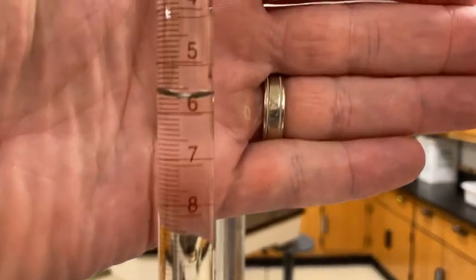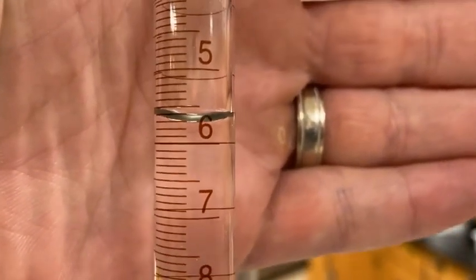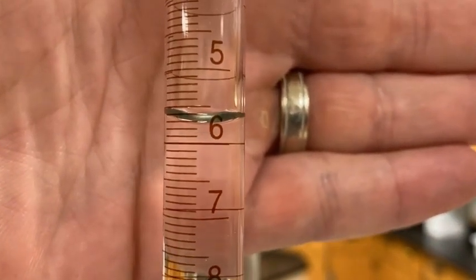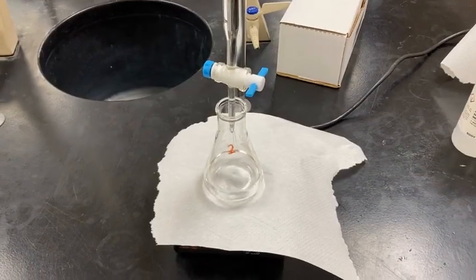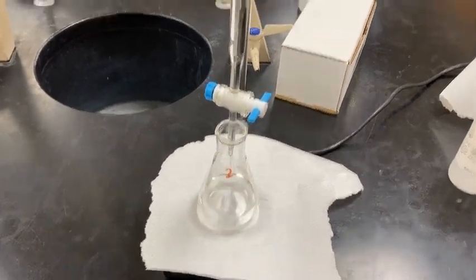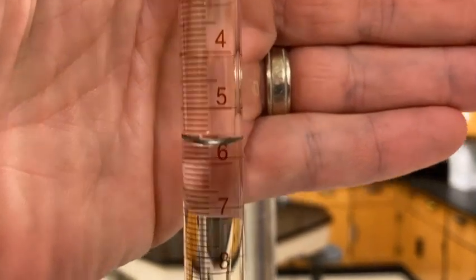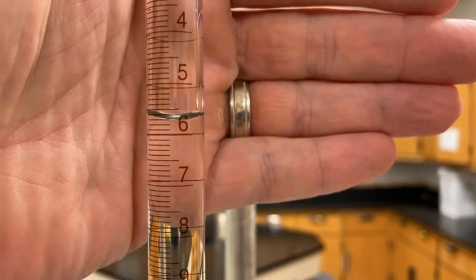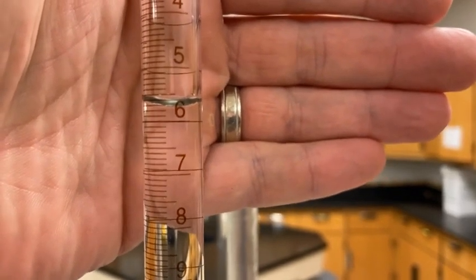So this is the final volume for this titration. Let me get a little bit more even with it. Watch your increments and go ahead and take that final volume for sample 1. All right, for trial 2, same thing. We got it all set up. I'm going to use the ending volume from our first trial as our initial volume for the second. Might have altered a little bit when I was moving things out and in, so I'll let you get that.